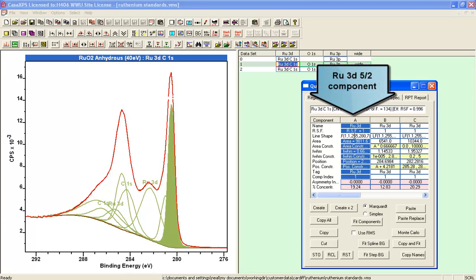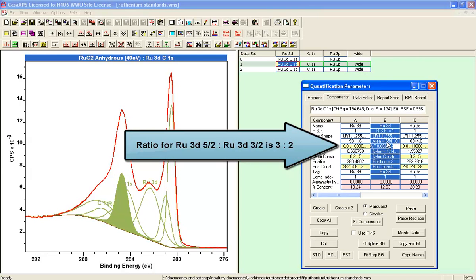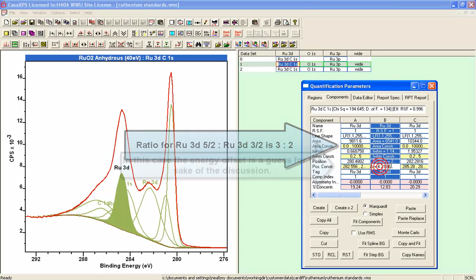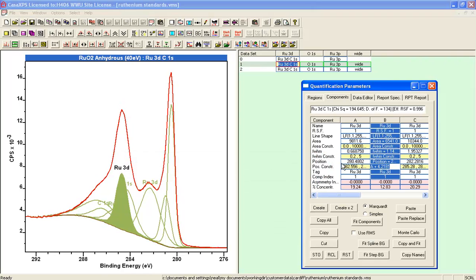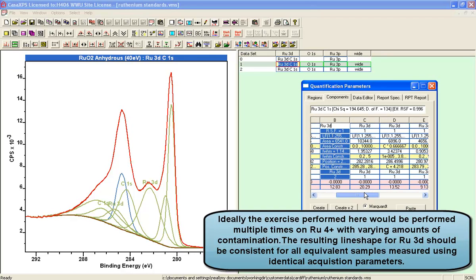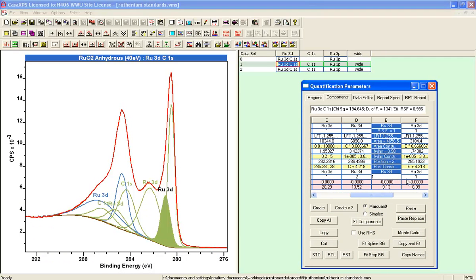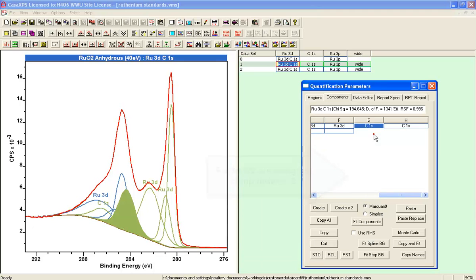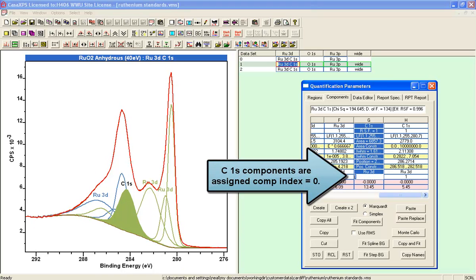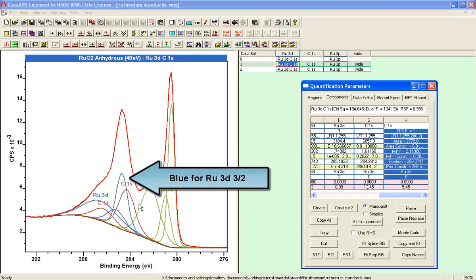But we also have a relationship in here that we might want to highlight. So for example, we've got a ruthenium 5/2 and a ruthenium 3/2 peaks within a doublet, and these are related by known proportions in terms of intensity, and we've also introduced an offset between the peaks to add some kind of structure to this peak model. The idea is we could highlight, for example, that this is a 3/2 peak by assigning a different index. So we'll go through, and each one of these 3/2 peaks we will assign a value of 2, so you can now see that these 3/2 peaks are this cluster of blue peaks, and we also have a couple of carbon 1s peaks here, and we'll set these to value of 0. So these peaks now represent the carbon.